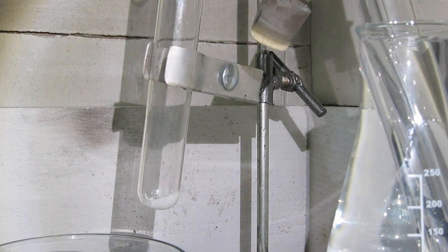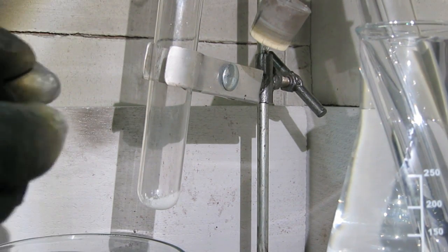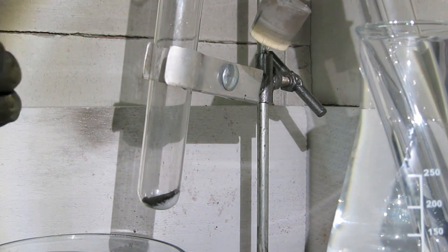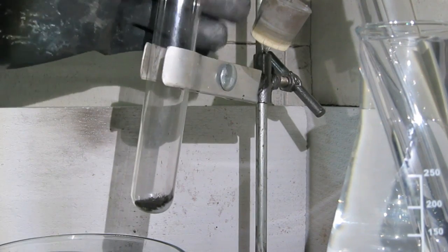Potassium bromide. This is the MnO2. Mix a little bit.